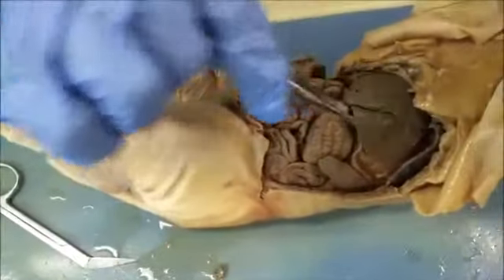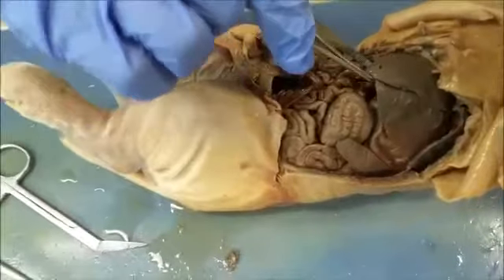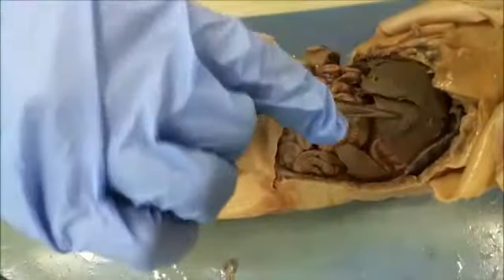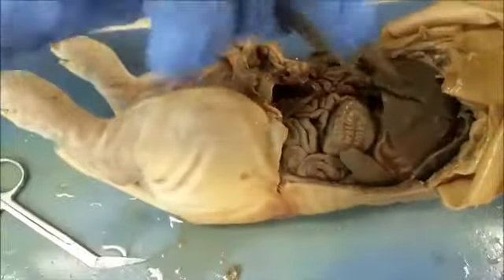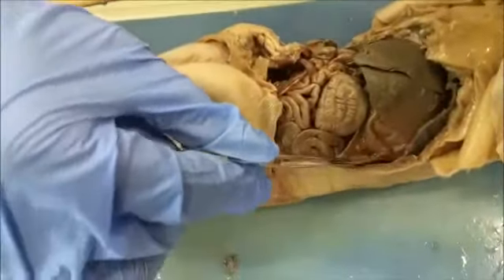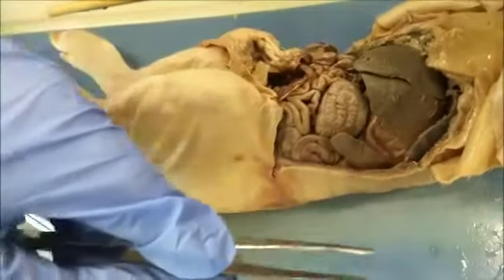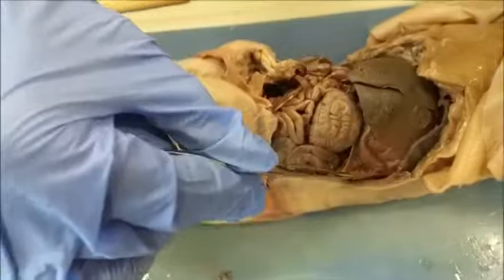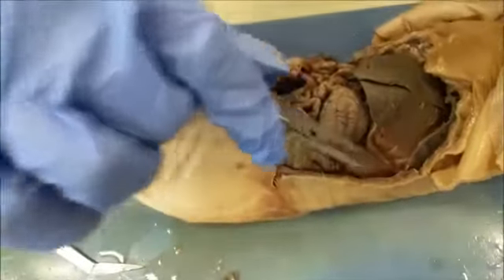The liver, as you can see here, is an organ that's generally used for detoxifying. It can store a lot of glycogen, which is used for energy. The spleen is where red blood cells will go through apoptosis, which is programmed cell death. So when a blood cell is close to dying, it'll go here and die within this organ.